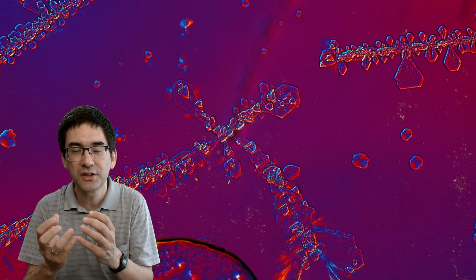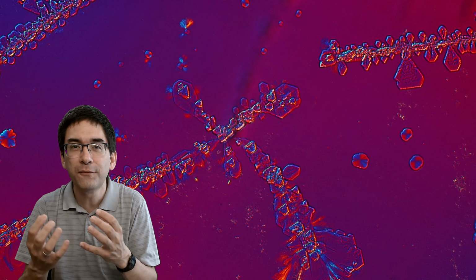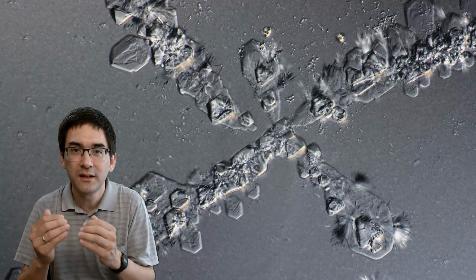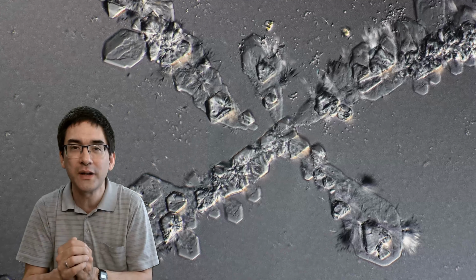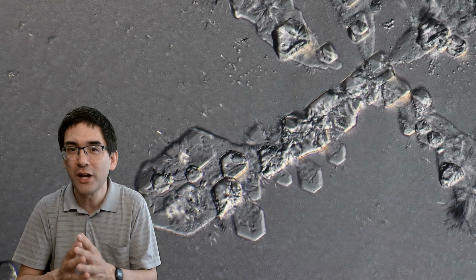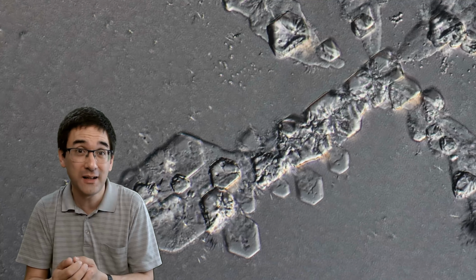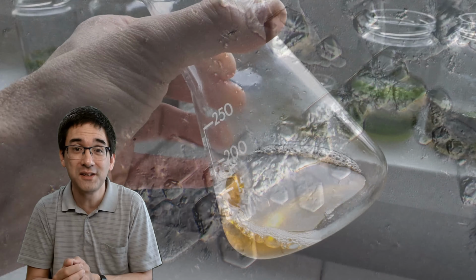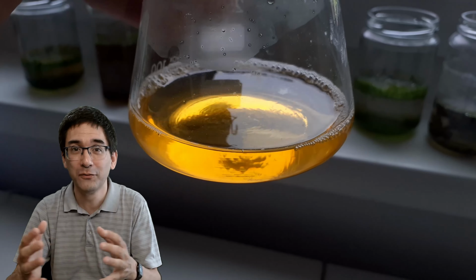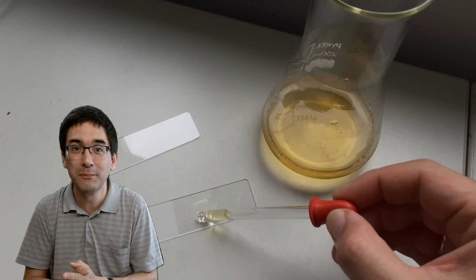The crystals now really show their shape, and they're less diffractive, with fewer artifacts, I would say. So this here, for example, is our crystals covered with saturated water. I'm going to show you a few pictures here, and you can also see that the colors changed a little bit. And look at the nice hexagonal shape here. Well, I'm not able to identify what substances these are, but it doesn't matter. I think just by trying it out, you get all of those fractal, beautiful patterns, and that's already reward enough.